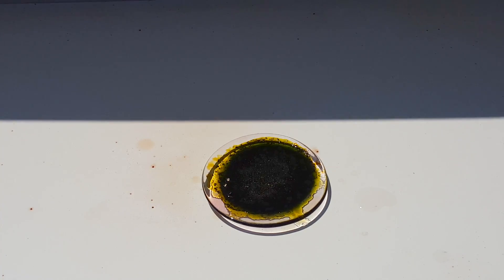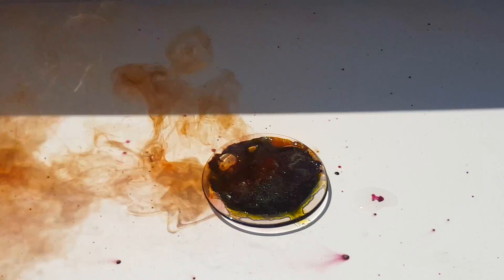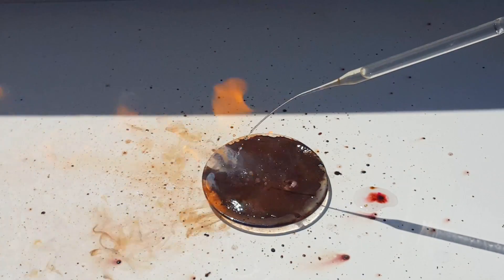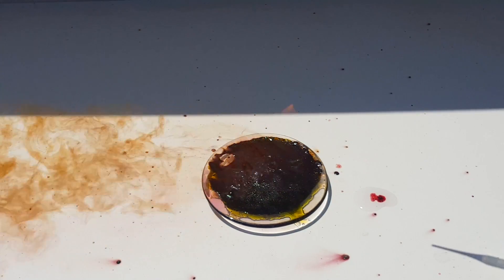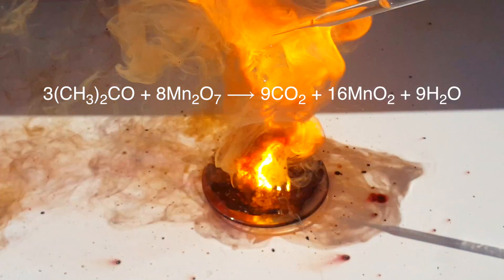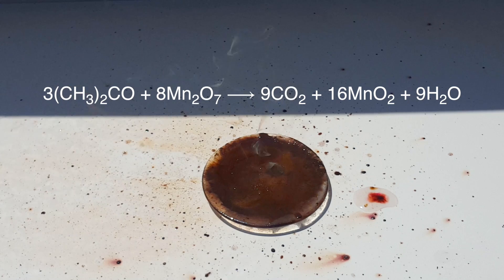The typical reaction people tend to perform when showing off Manganese Heptoxide is with acetone, so I'll start with that. Here you can see that as soon as the acetone makes contact, it goes up in flames. The reaction here is quite simple, where the acetone is oxidized by the Manganese Heptoxide into carbon dioxide and water. This actually happens for a very good majority of organic solvents.